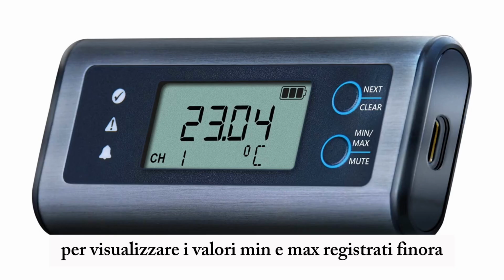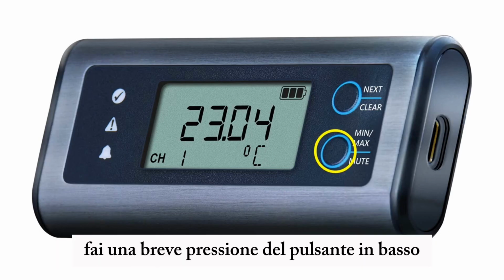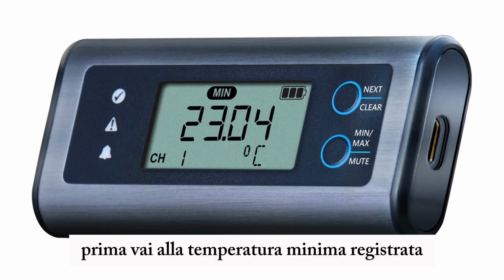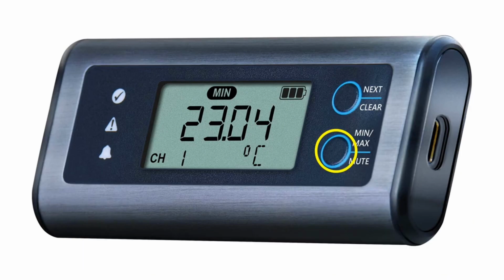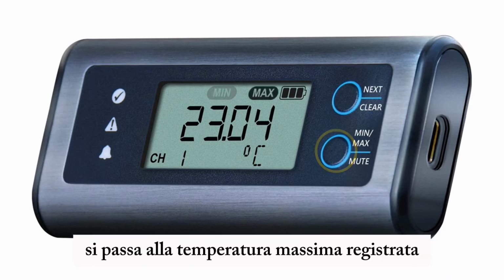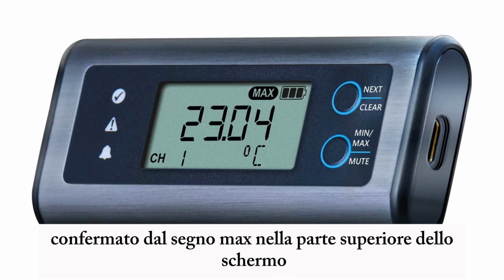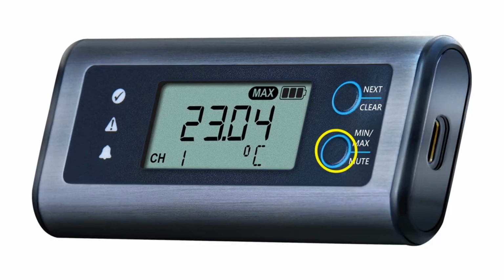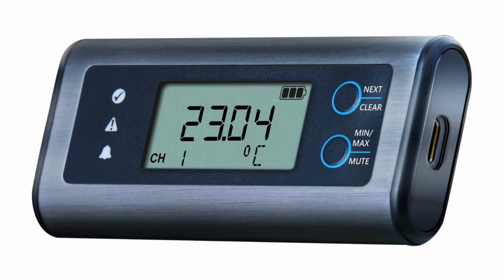To view the min and max values recorded so far for each channel, you do a short press of the bottom button. First you'll go to the minimum temperature recorded, which is confirmed by the min sign at the top of the screen. And if you press the bottom button again, you go through to the maximum temperature recorded, also confirmed by the max sign at the top of the screen. If we press the bottom button one last time, we come back to the current temperature readings.